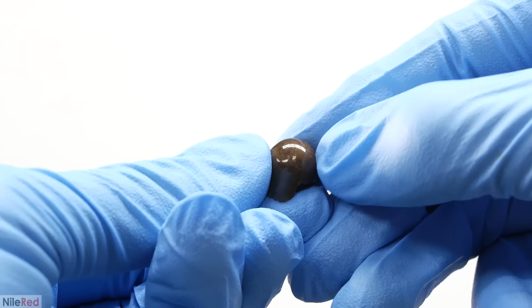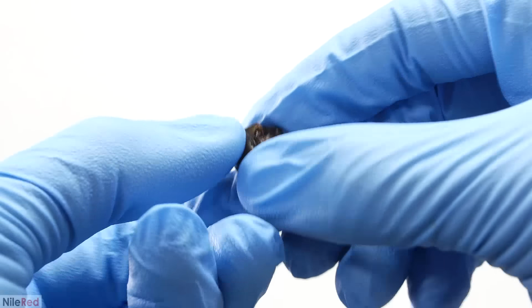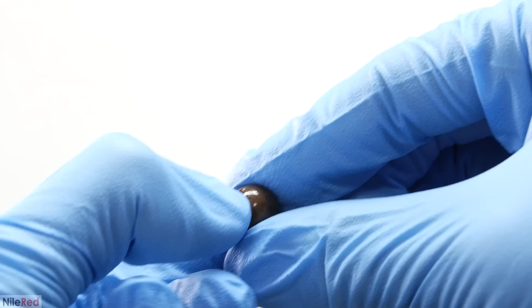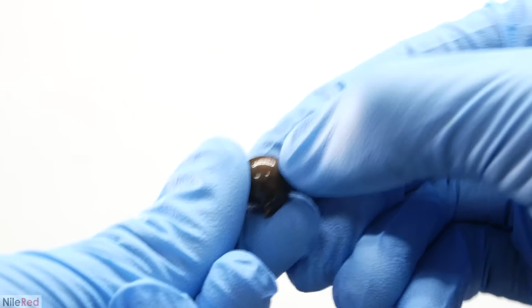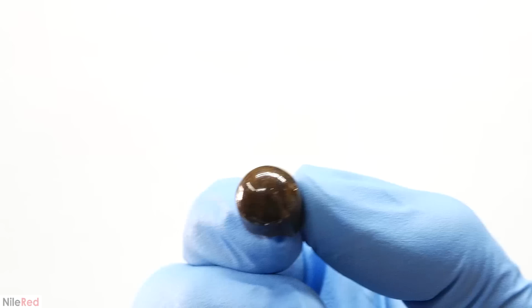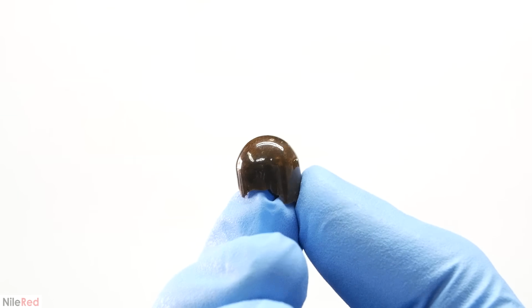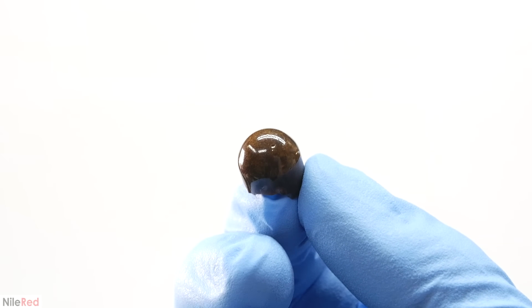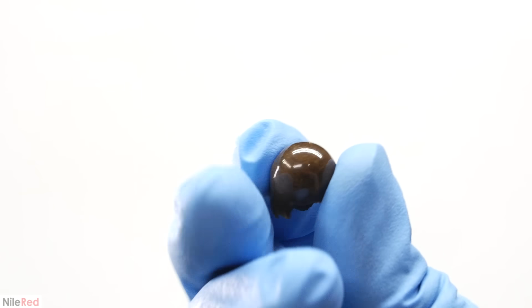Despite the fact that it was low quality and dirty, I was honestly impressed with it. The portion that was in contact with the test tube was very shiny and smooth, but the inside was a little bit bubbled up. After seeing what I made here, I decided that I would for sure make nylon the other way. The other way is a lot cleaner, and I should be able to get a much higher quality nylon out of it.